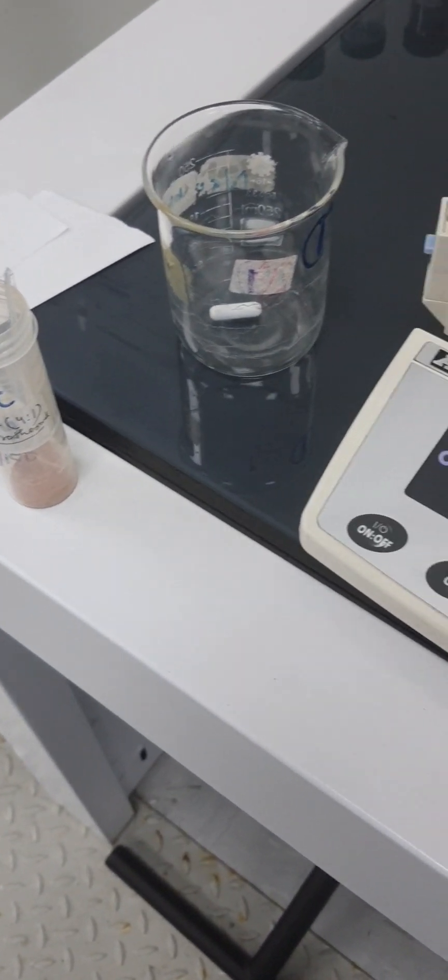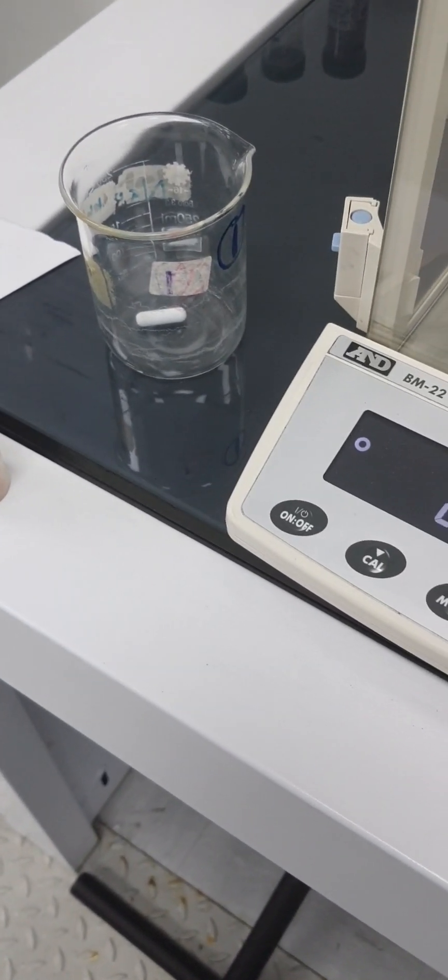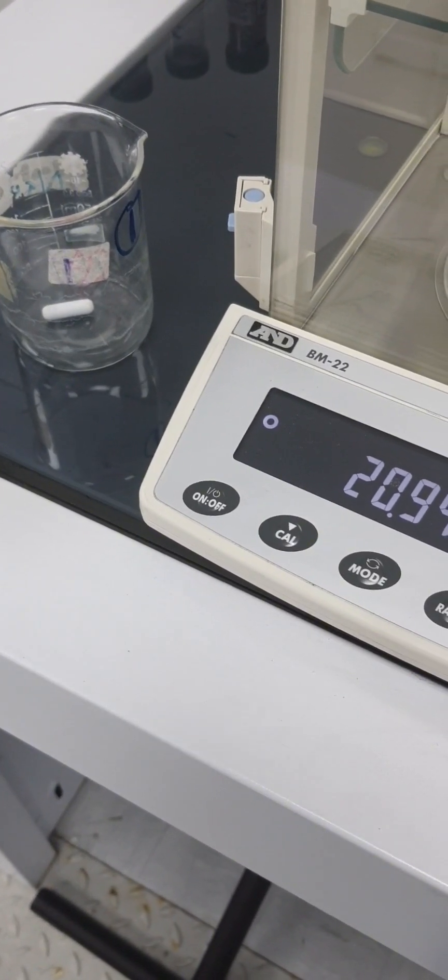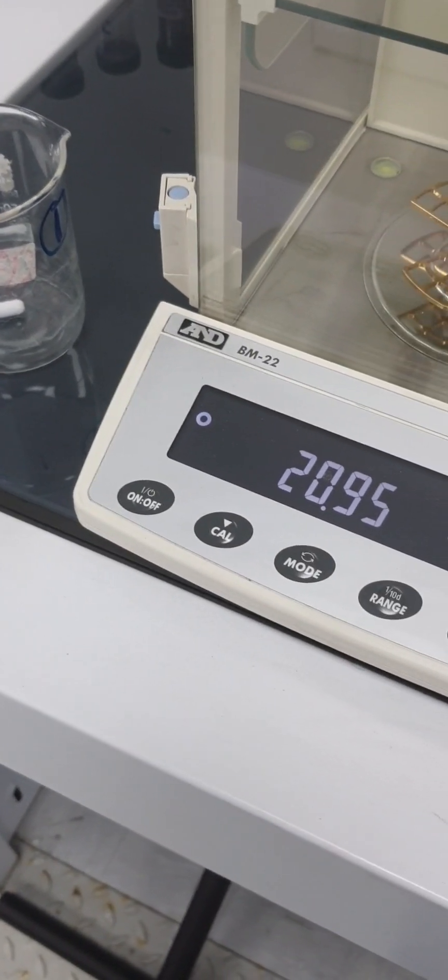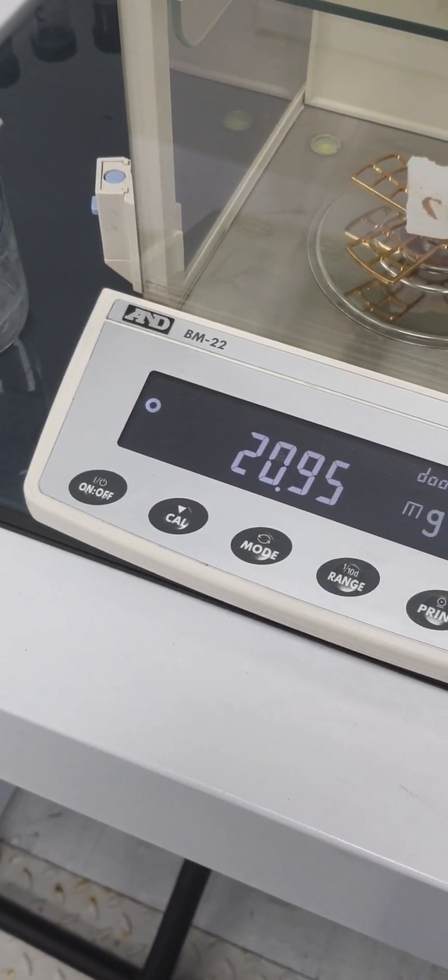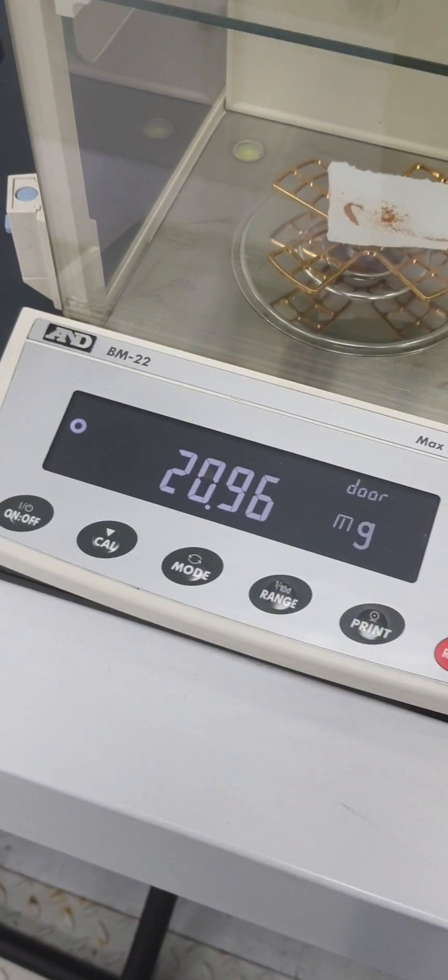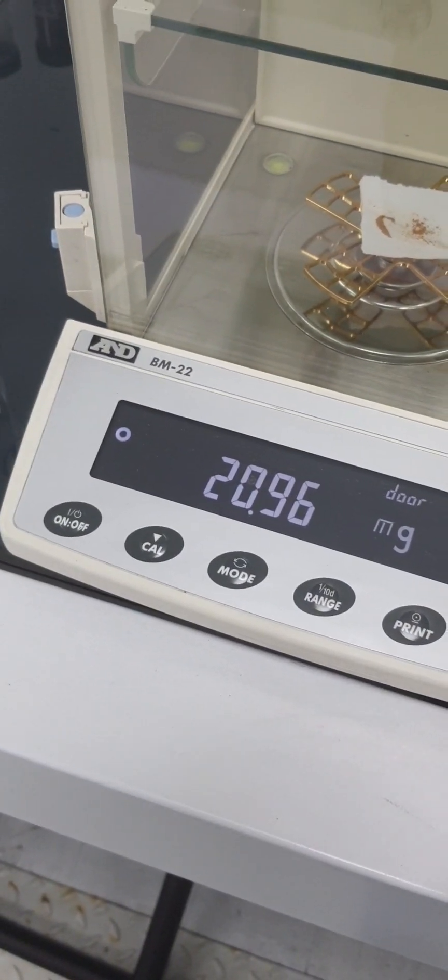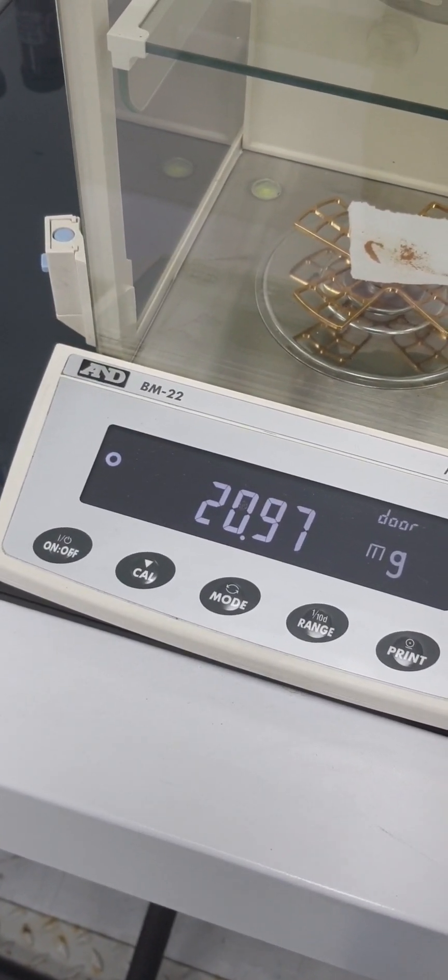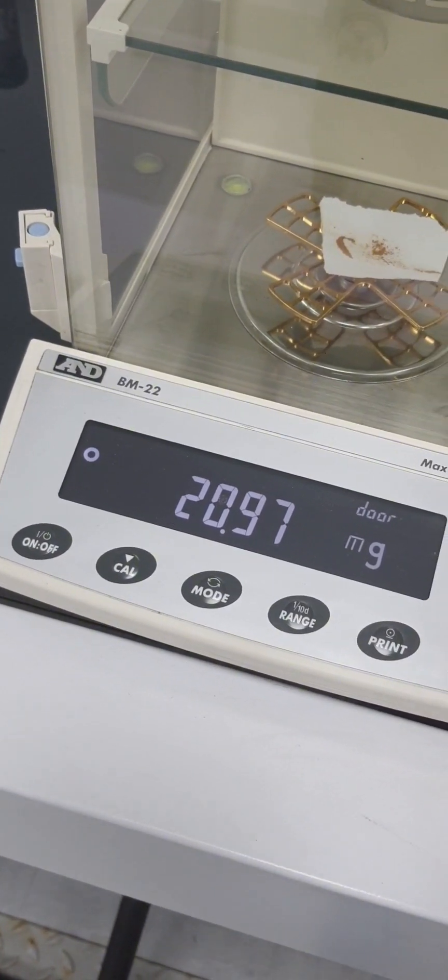First step we'll do the adsorption. Here we are adding around 20 milligrams of the catalyst. We'll be fixing this and also fixing the pollutant concentration, the time of the trial run or the experiment. Now I've started to run the experiment. In this case I'll not switch on the light. I've added the catalyst and I'm running this for around 1000 rpm and we'll cover this so that there is no light activity.